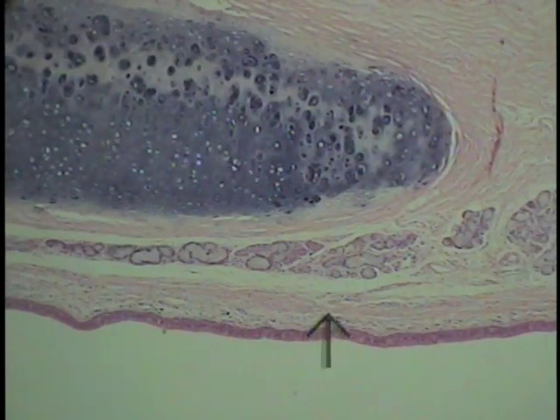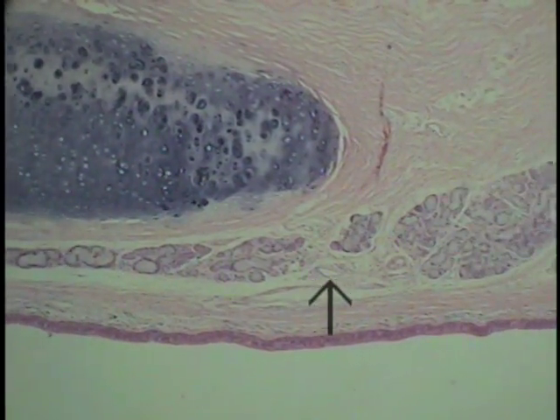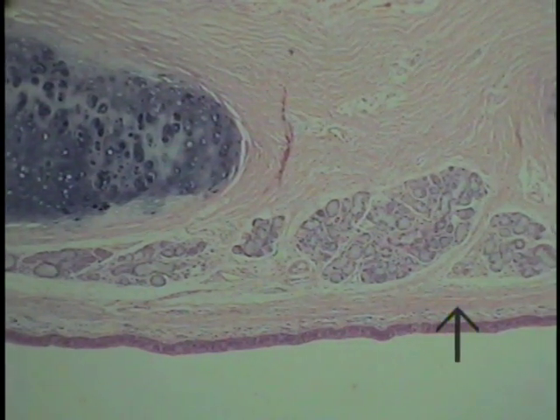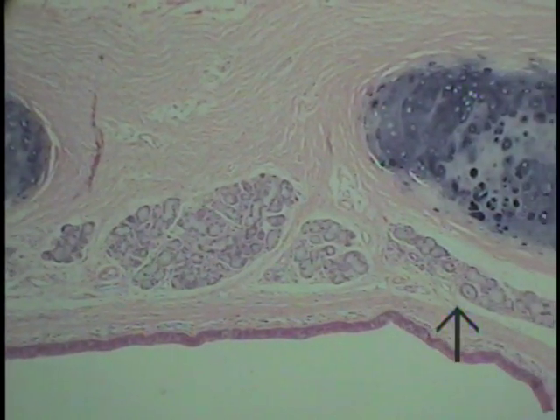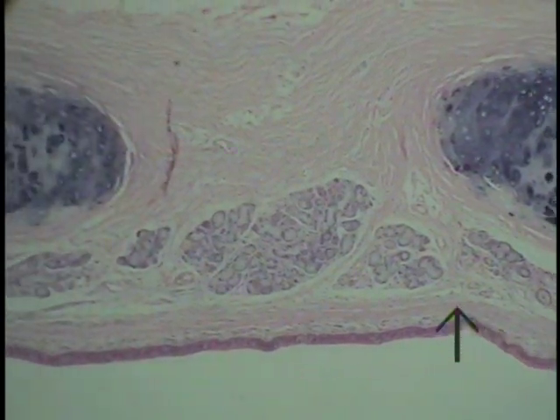Once again, the slips of smooth muscle can be seen separating the lamina propria from the submucosa. Please be aware that there are several regions of the trachea where these smooth muscle slips forming this fine layer are not as obvious, very difficult to see, and some authors indeed will remark that it's lamina propria throughout its extent in containing these glands.